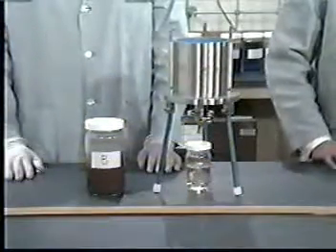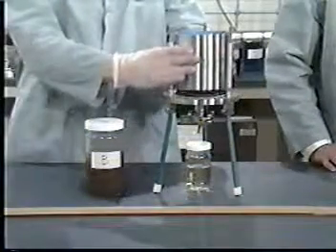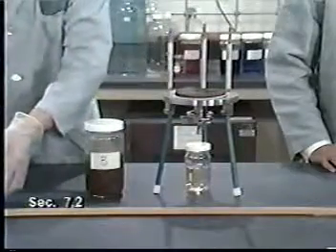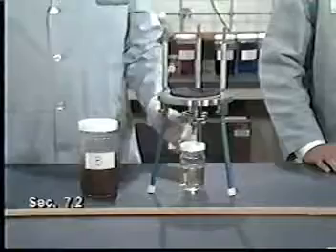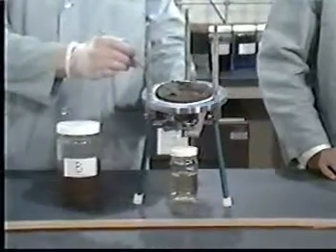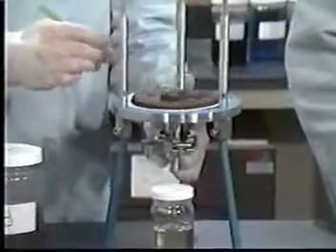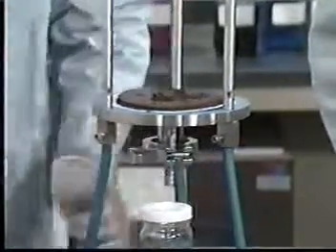If the waste sample obviously has a significant amount of solid material, as waste B did, the solid phase must be subjected to extraction. In that case, the next step is to determine whether the sample needs to undergo particle size reduction, followed by choosing which extraction fluid to use.